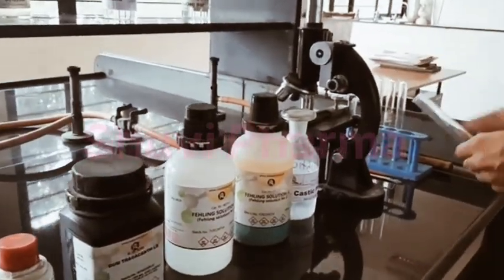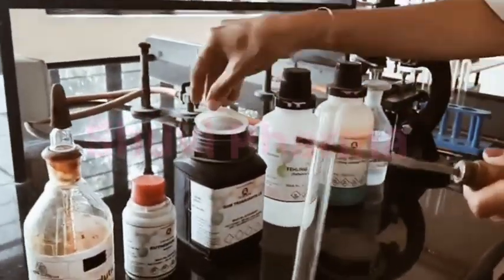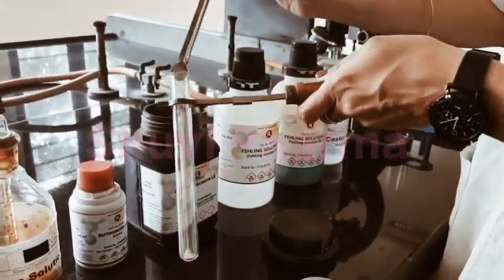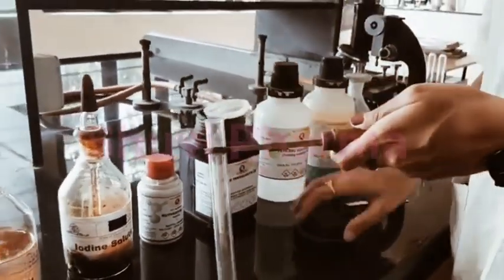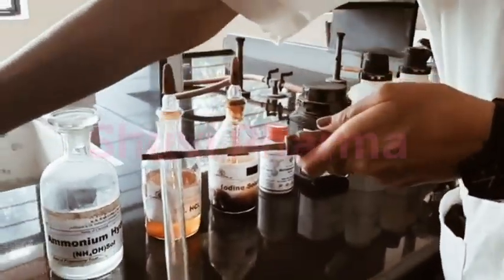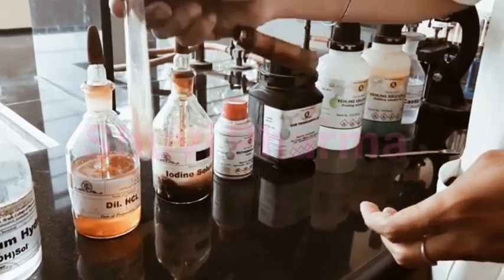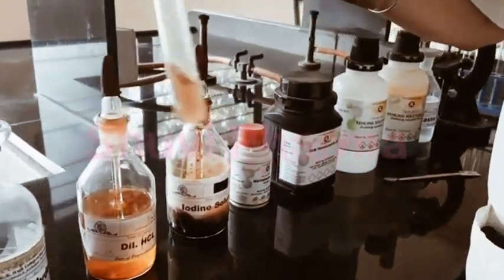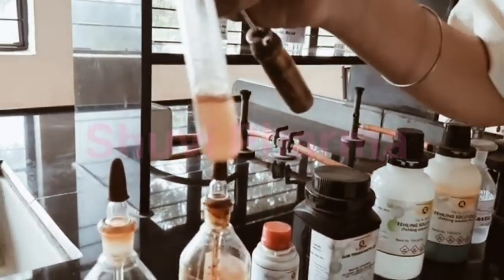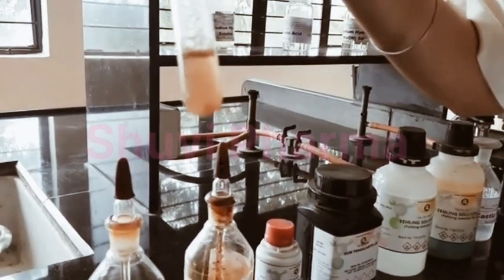So now we will perform the first test, that is solubility. First we will test the solubility in cold water. Here you can see it is not completely soluble, it is partially soluble, and then the powder starts swelling, so it indicates the presence of tragacanth.